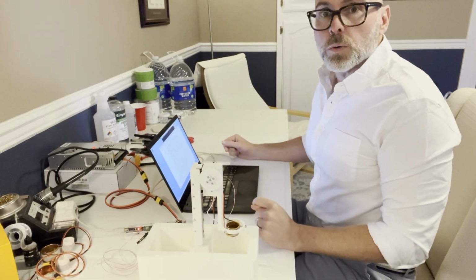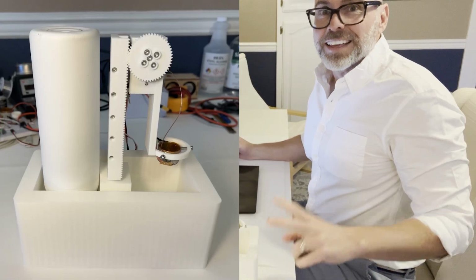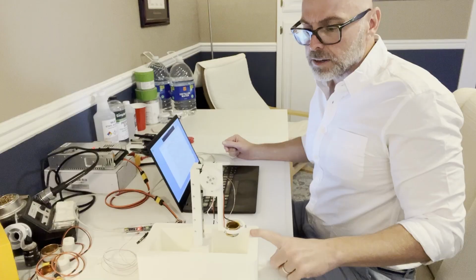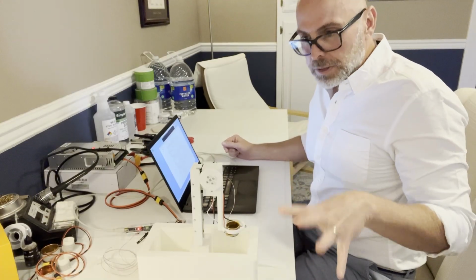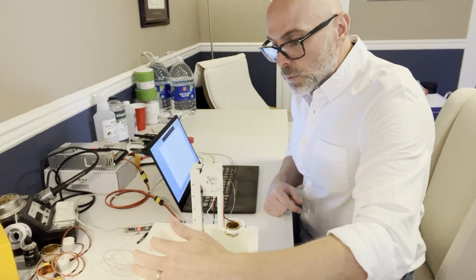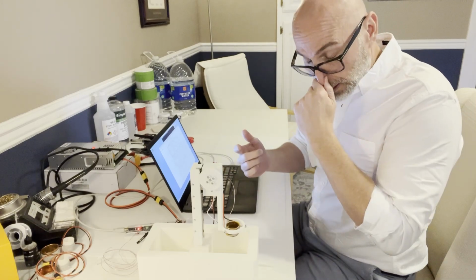Okay, so I'm going to give an update today on the Cryo device here. A number of things have happened. I think I may have recorded a video in which I was collecting the data to train a model to then be the simulator to then train a controller to control the heater and the plunging into the liquid or whatever. So in this setup, this is all just with ice. I'll do it next with the liquid nitrogen.